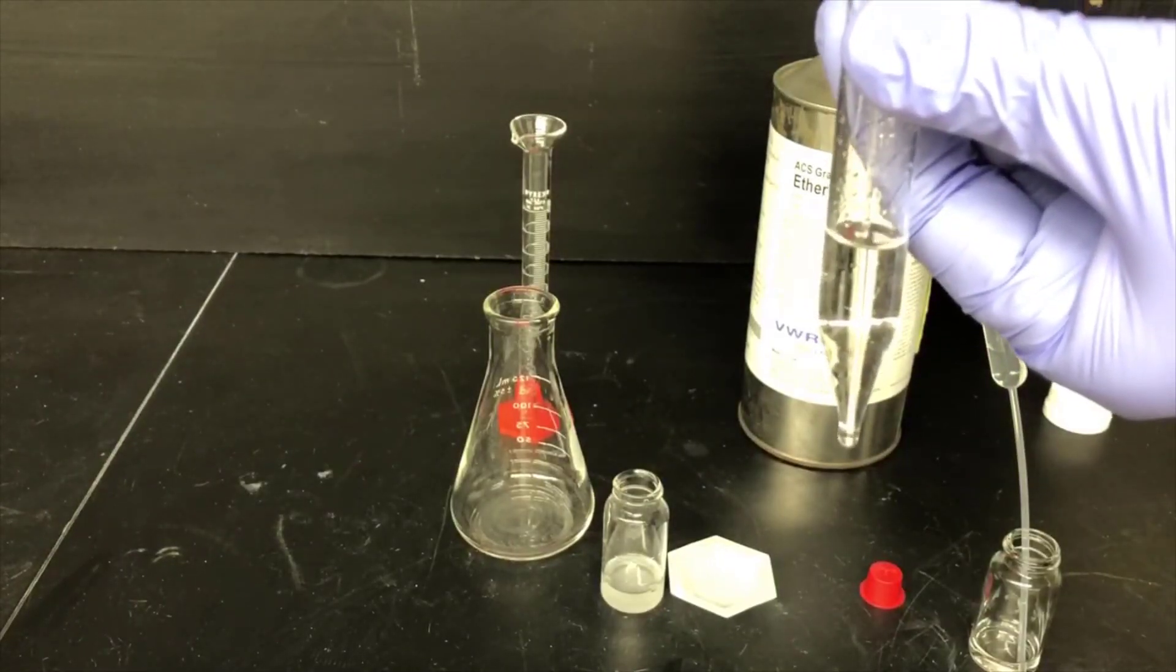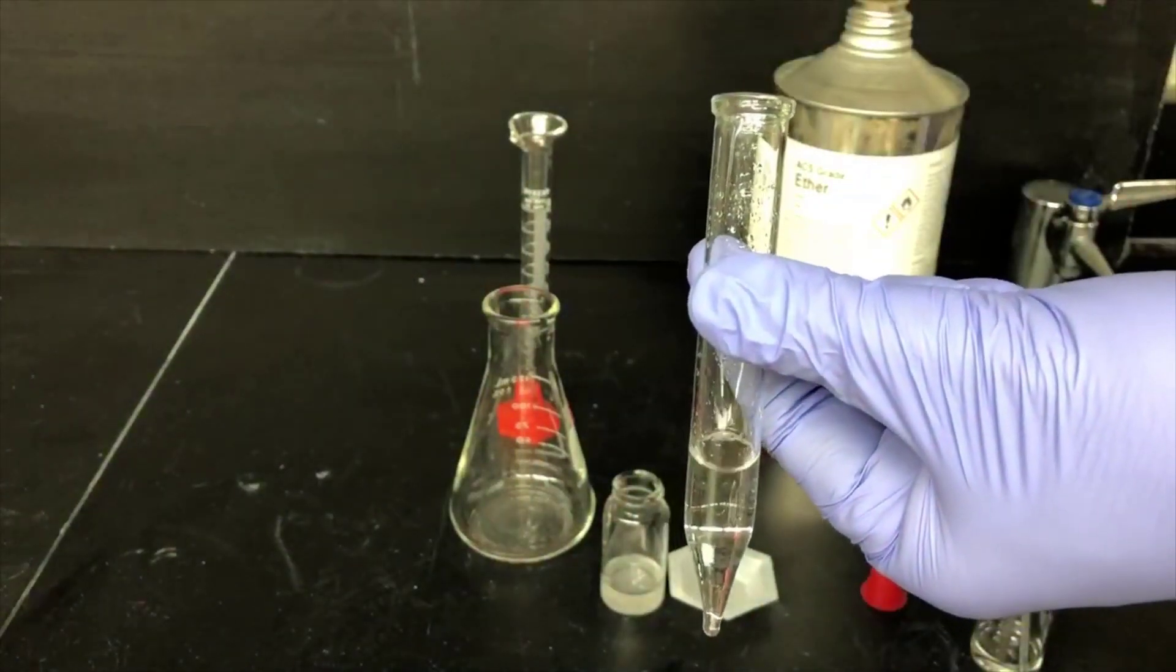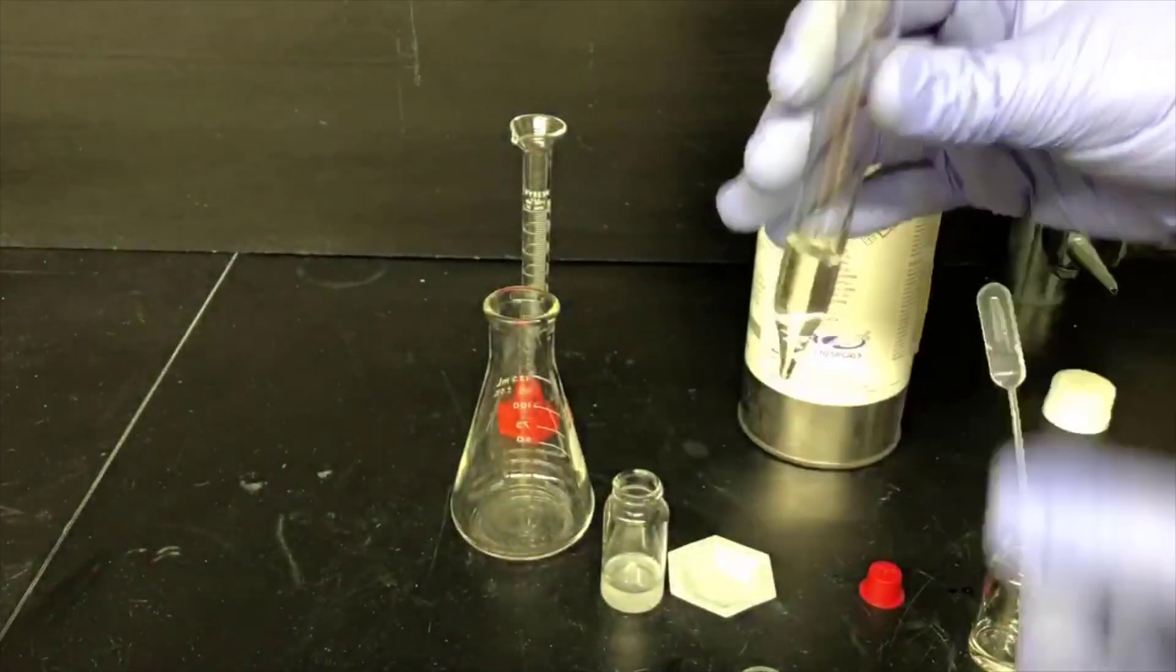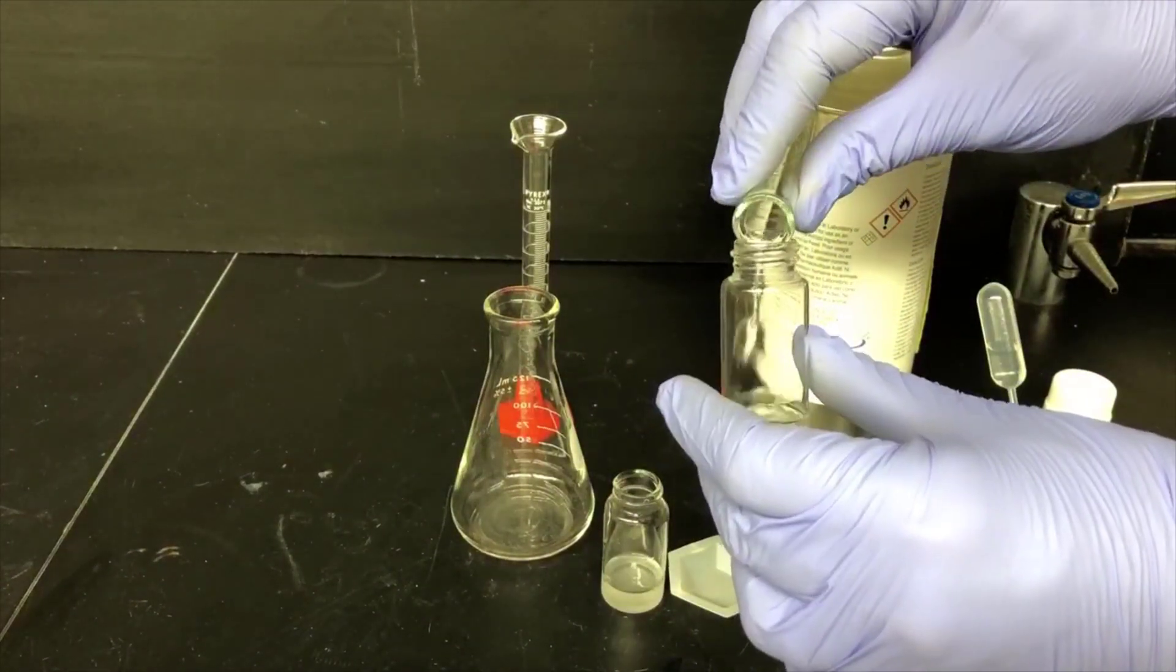Now I'm just removing those few drops of water I just added, and I'll pour the organic layer into a clean dry vial.